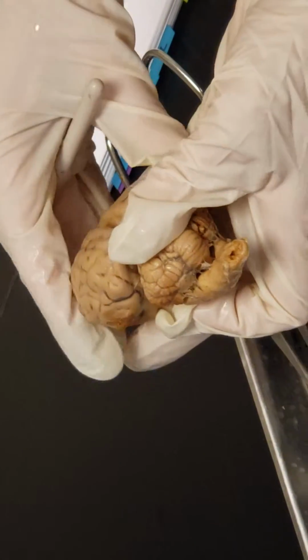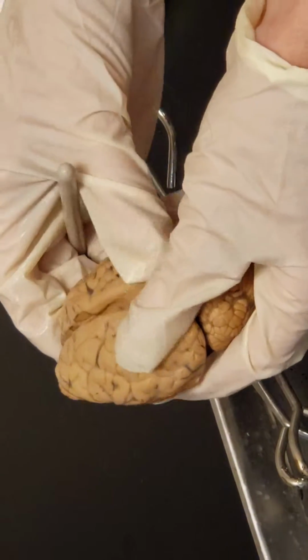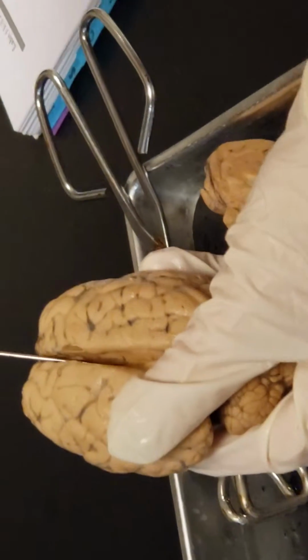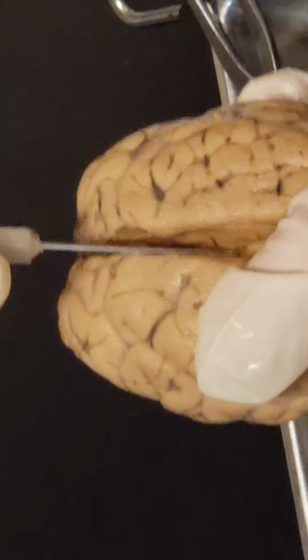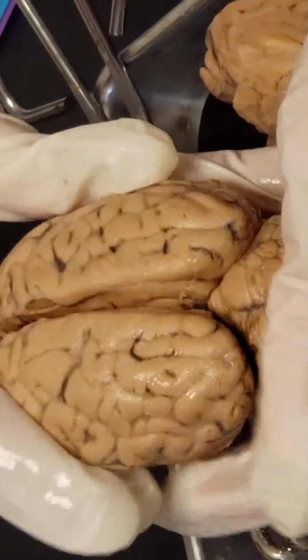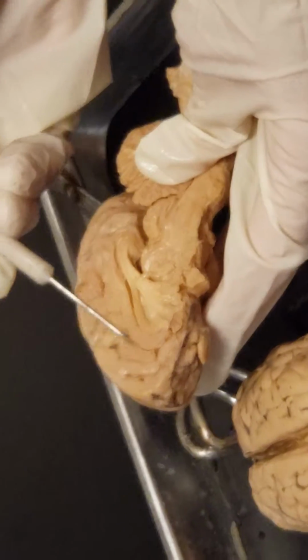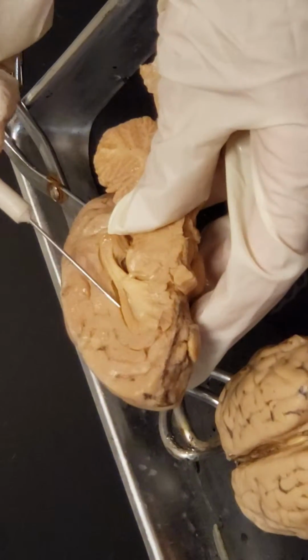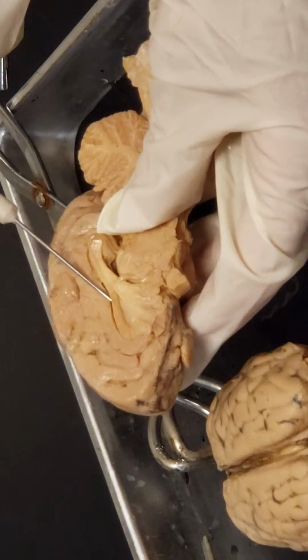So in the mid-sagittal section, the corpus callosum. This is not a mid-sagittal section, but we can clearly see the corpus callosum if we open this up. That's going to be the commissure, or the tract that connects the 2 sides of the brain that's most superior, right inside that longitudinal fissure. Okay. So if I do move to the sagittal section, this is not cut tissue, but this is cut down here. So here's our corpus callosum right here.